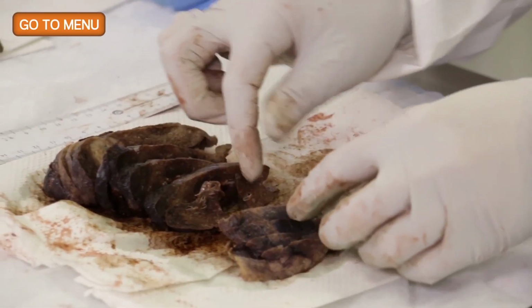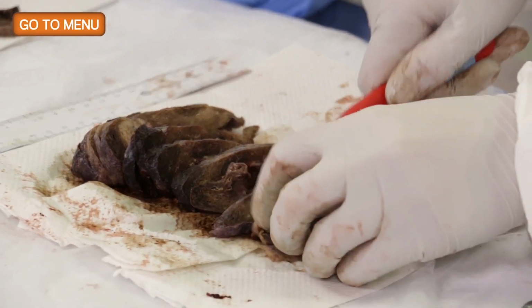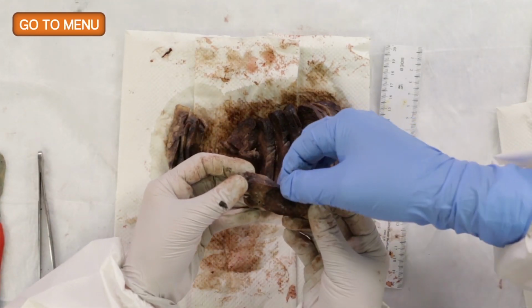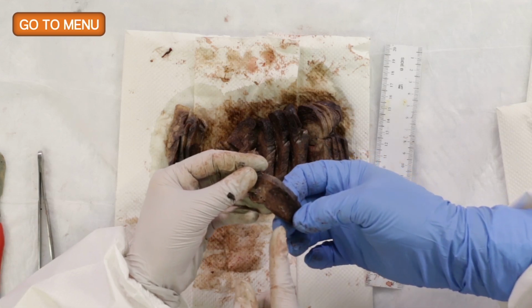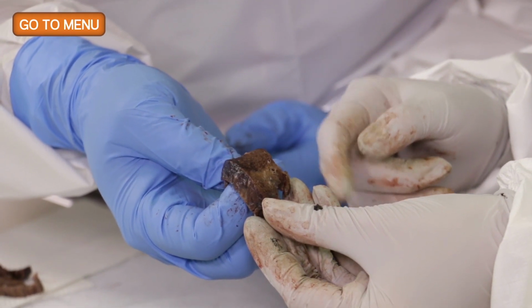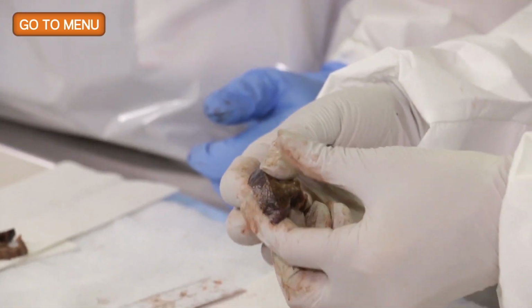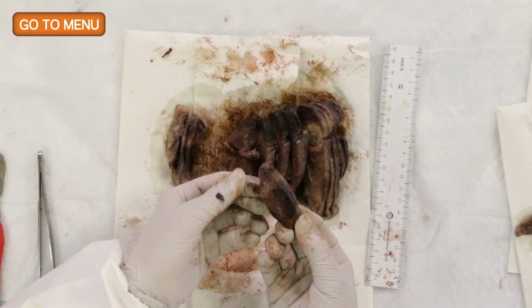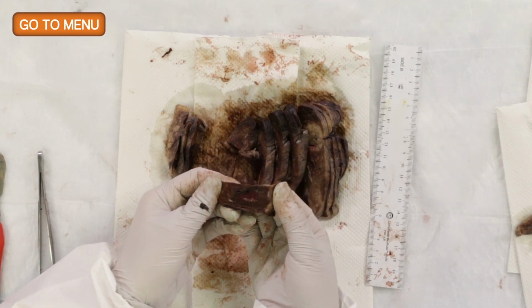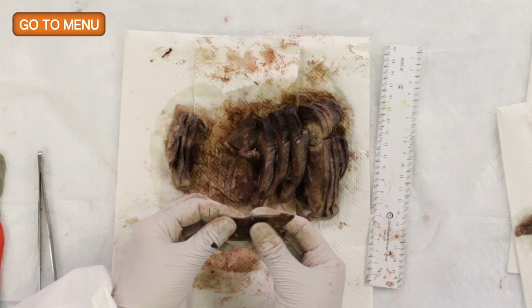Other features, as you're holding the specimen up in the slices, is that when we look at the cut surface, why don't you hold that up and tilt it a little bit this way? Okay. Actually, you can see the light. You see the air spaces right now? Are they visible? No, not in that area. Not particularly, right? So if at an arm's length the air spaces are visible, that's usually a sign of emphysema or some abnormality. But if it really is stretching and straining to see the alveolar spaces at arm's length, they're probably relatively normal. So if they feel normal and they look normal, then you can move on.